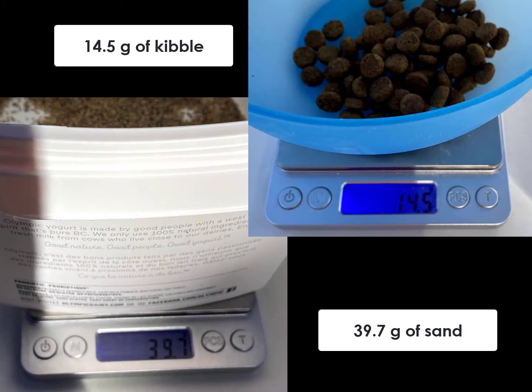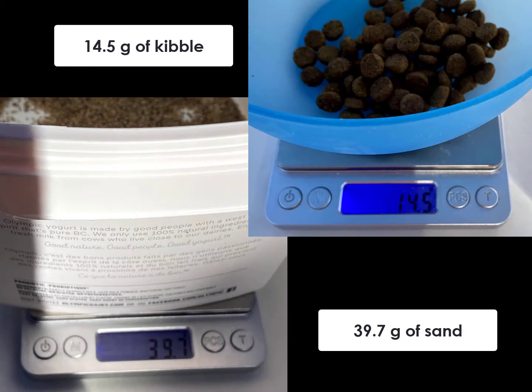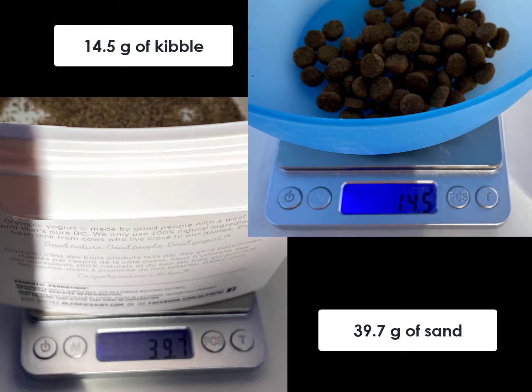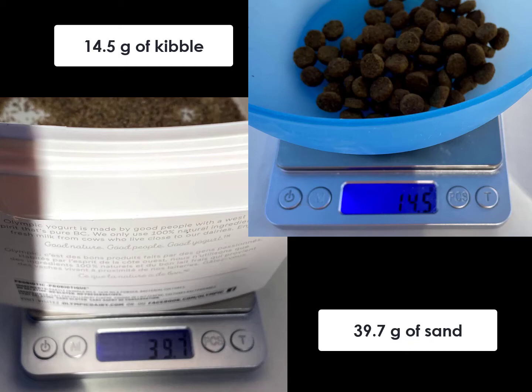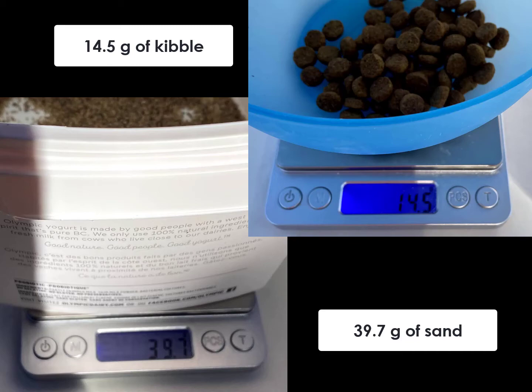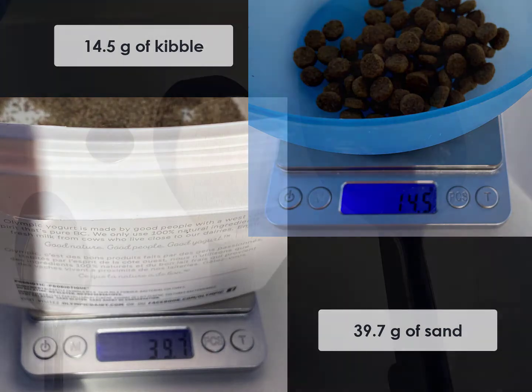What do we see? In this case, 39.7g of sand and 14.5g of kibble. We're still missing about 0.8g, which could be due to drafts, static causing sand to cling to the sides of the plastic containers, or just the cheap balance. In any event, our errors are now about 12g, or 44% on sand. Still a massive error.